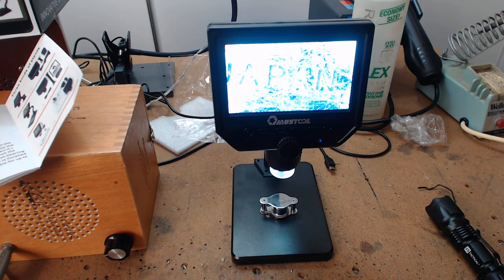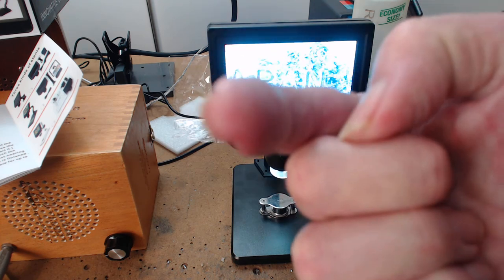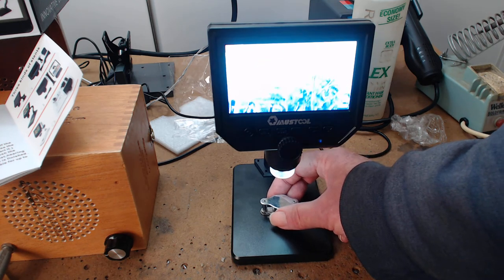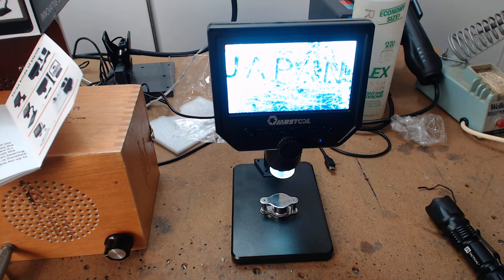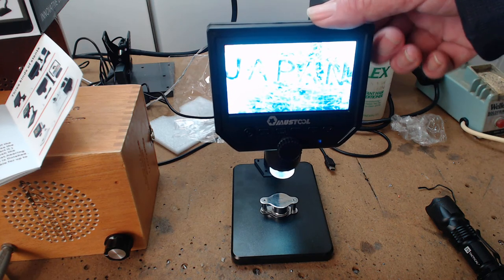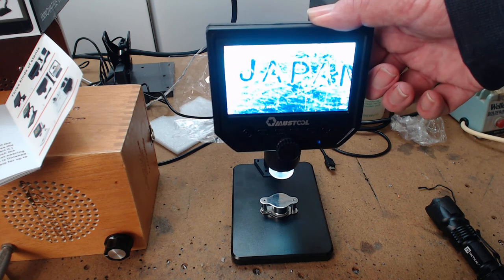Okay. So as I was moving this, you couldn't see it. Oh, that's another thing. This camera here looks like it's looking at something else. And China on the label. You sort of keep putting up with the same stuff. Let's see, does it say Japan? Nice. And we could change the brightness. Notice you can see all the scratches on the top of that unit. Now let's find the brightness.